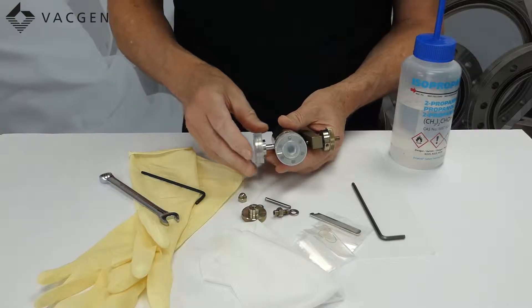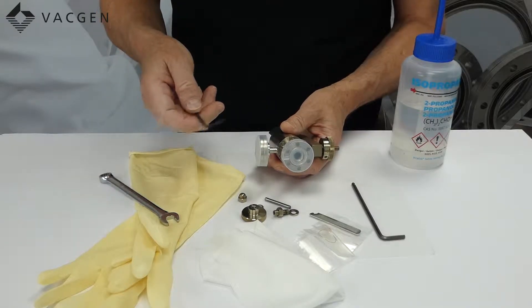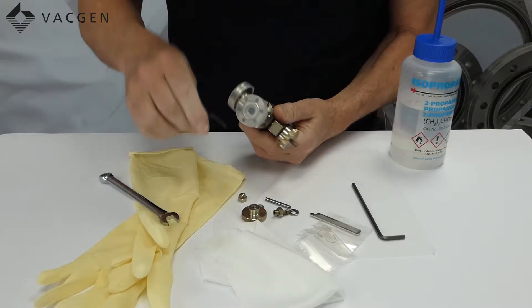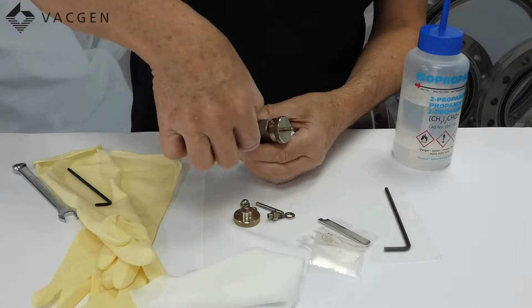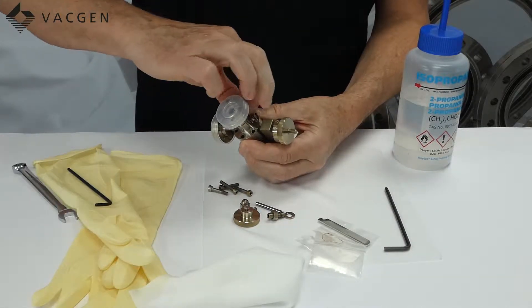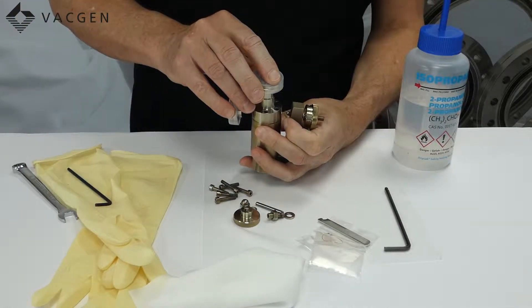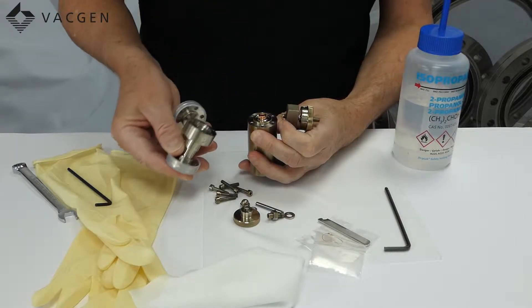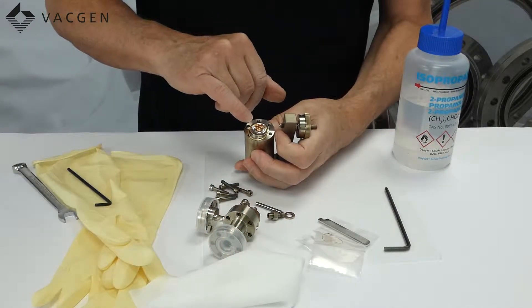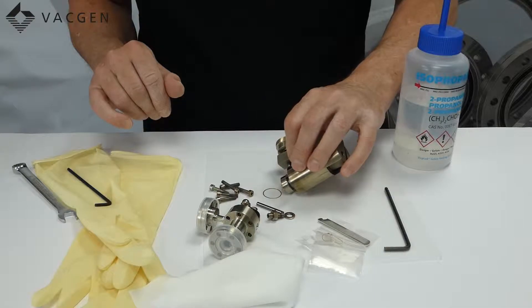If you can, it is probably best to put caps on the valve like I have got here. This just protects the knife edge from fingers and anything that might catch it. The next thing we do is undo the screws that hold the valve together. Now I have undone all the screws we just need to remove them. This now allows us to remove the lower body — just be careful when you remove it. This is where the Mallory pad seals on the base. This is the Mallory pad which is the item we are going to change, and the gold seal. We can just drop this out and then we can go to the gloves.